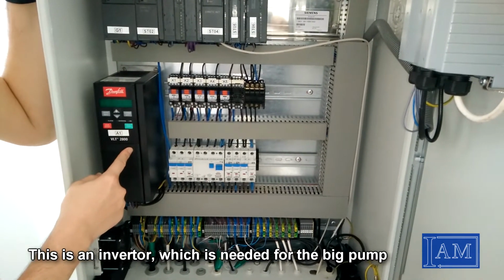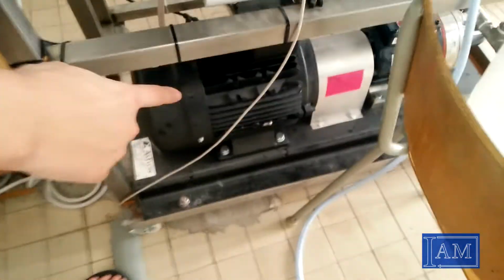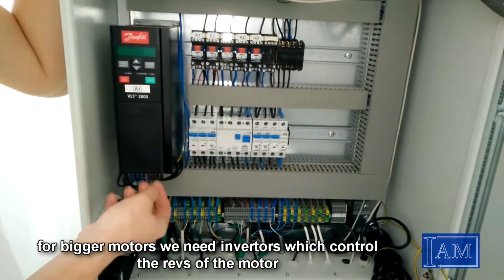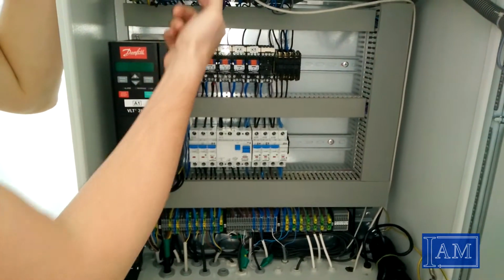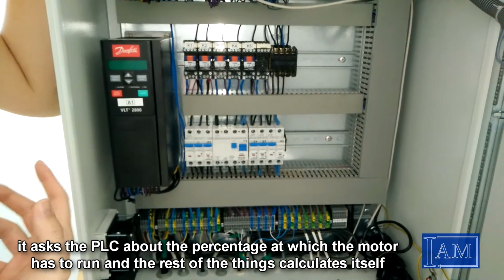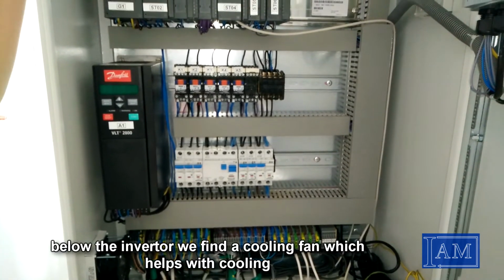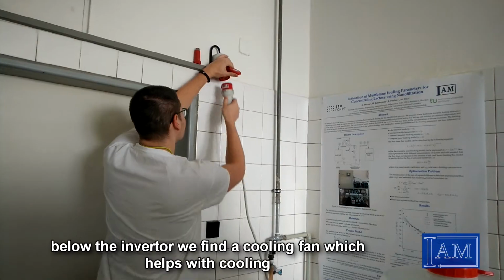This is an inverter, which is needed for the big pump or motor. For bigger motors, we need inverters which control the revs of the motor. It asks the PLC about the percentage at which the motor has to run and the rest of the things it calculates itself. Below the inverter we find a cooling fan which helps with the cooling of the unit.